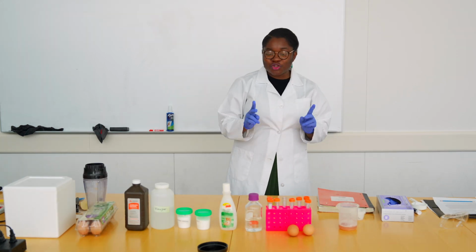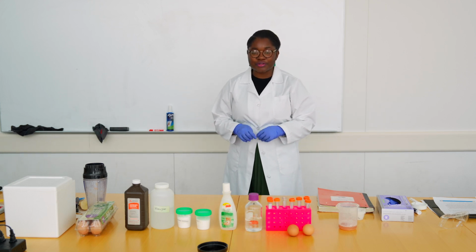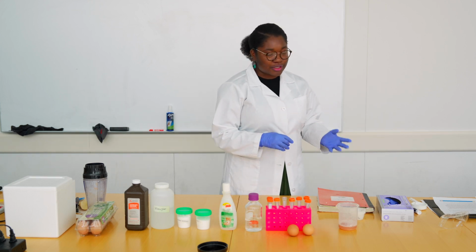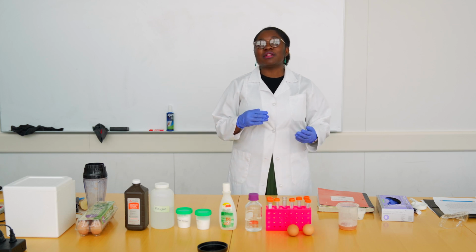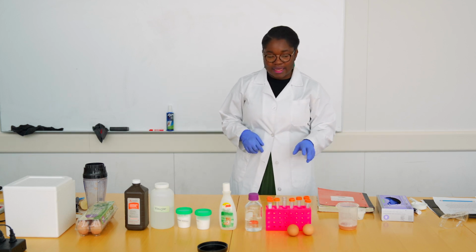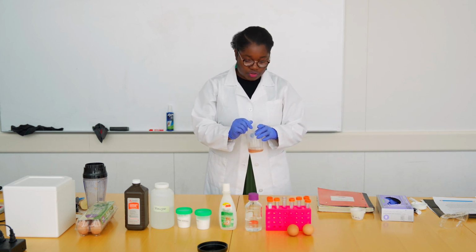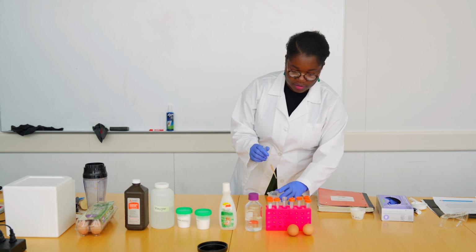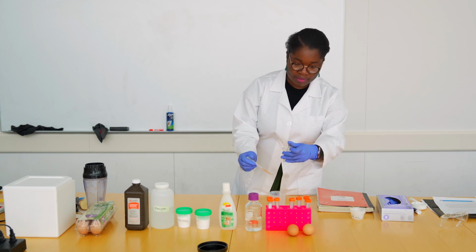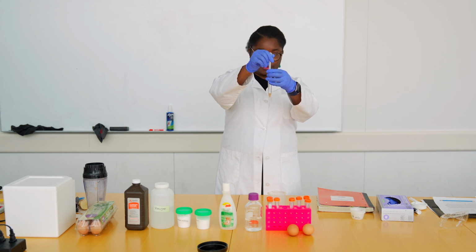We have completed 2 experiments. Well, we are still in process. And our third experiment has to do with salt now. So we are still using our potato juice, still evaluating the catalyzing activity of the potato juice. And you could still get your clean pipette, get some juice, about 1 ml, drop it into your tube that is pre-labeled.